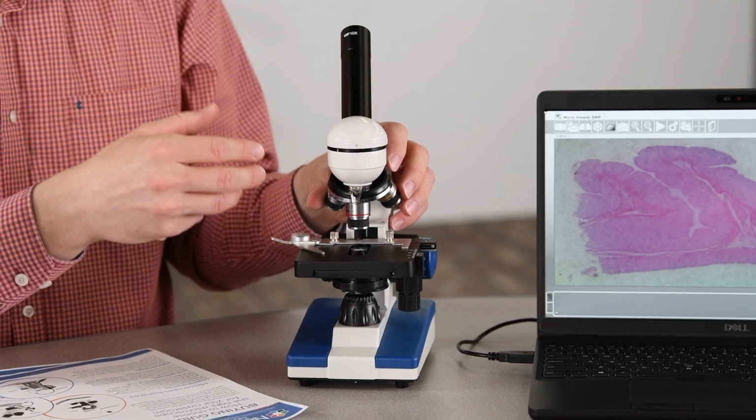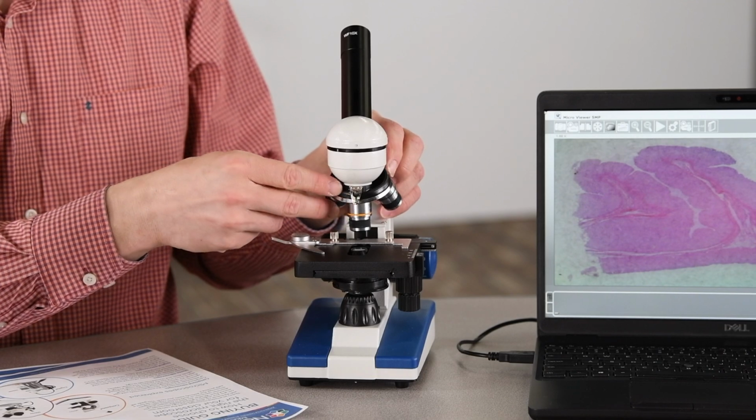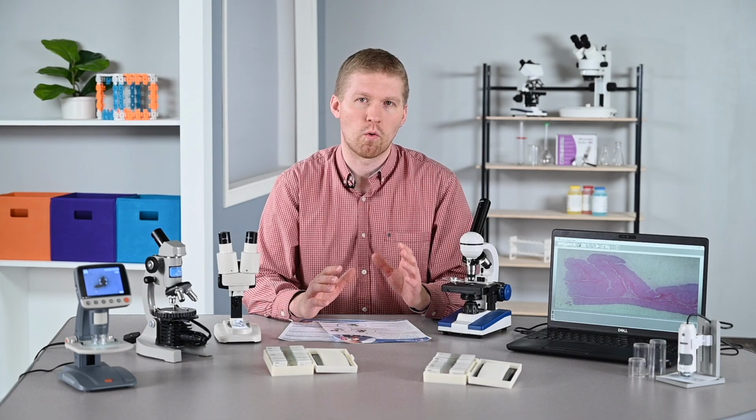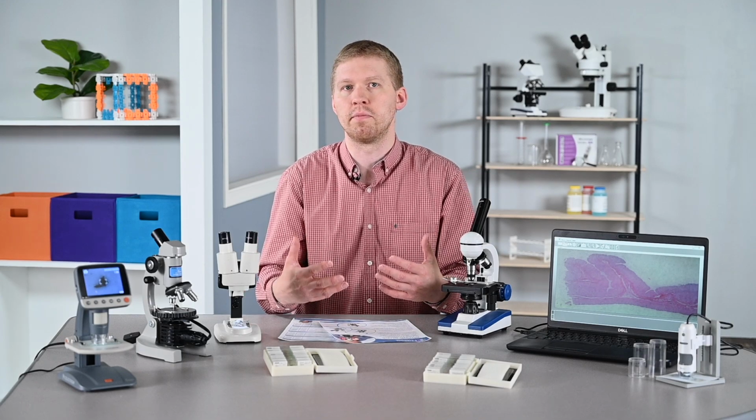of 3 different objective lenses. You have a 4x, you have a 10x, and you have a 40x. This means that it has 40, 100, and 400 times magnification. And this technically should be all you need for elementary or middle school, unless you are doing something a little bit more advanced. Once you start using a 100x objective lens, you're probably going to need a condenser and or a diaphragm, some dye or immersion oil or something else to get a clear image you want.